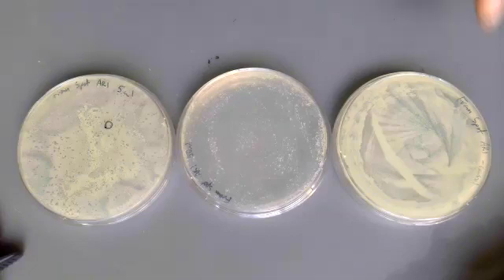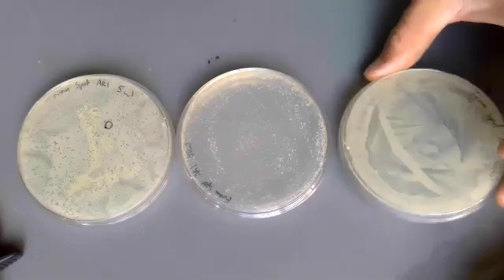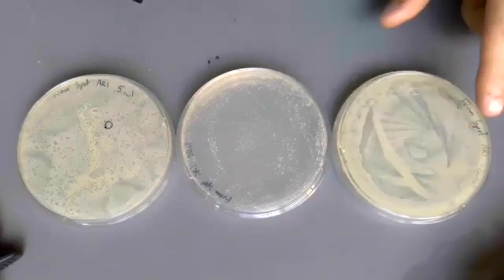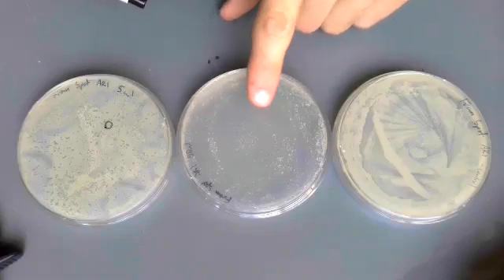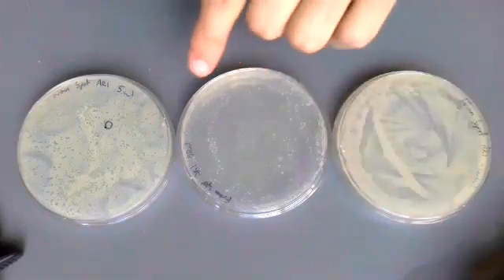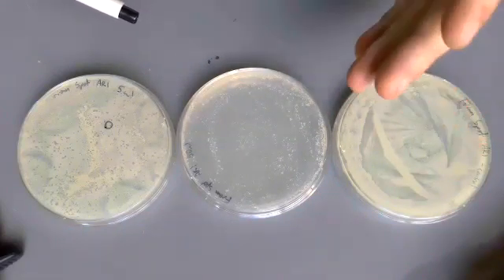So now we have the plates from the filtrate from the enriched isolation. We plated the host bacteria along with the phage sample. Here we see the negative control that just had phage buffer and no phage, and we see a nice bacteria lawn. Here in our more concentrated 50 microliter phage sample, we have less bacteria because more of the phage lysed the bacteria that would have been growing on that plate.